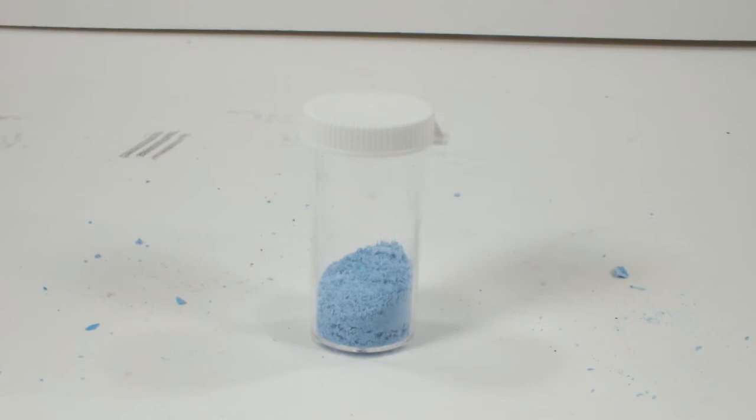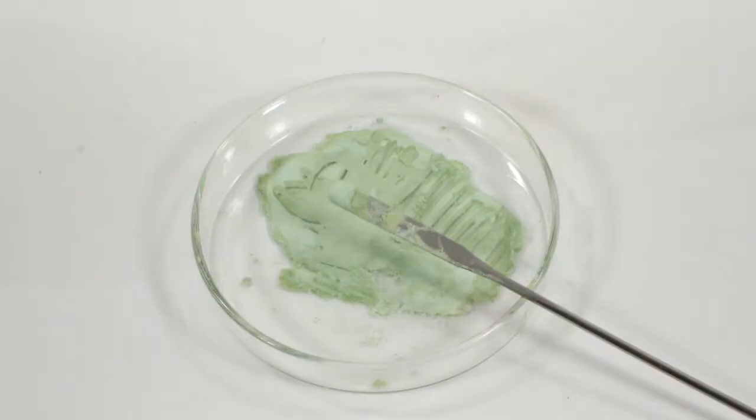But despite this pleasant powder blue color, it's not the lavender chloride complex I set out to make. So let's check on that one, shall we?